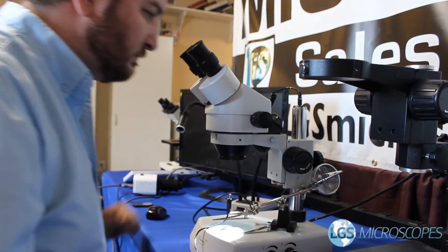Now usually, parallax is our best friend — it's what gives us depth perception, or 3D. That's why when you go see a 3D movie, you have to put on special glasses that show you a slightly different angle of things on the screen. The same is true with microscopes. With a stereo microscope, the huge advantage is that you can see three-dimensional objects and perceive the depth, the crevices, and all of the features that it has.